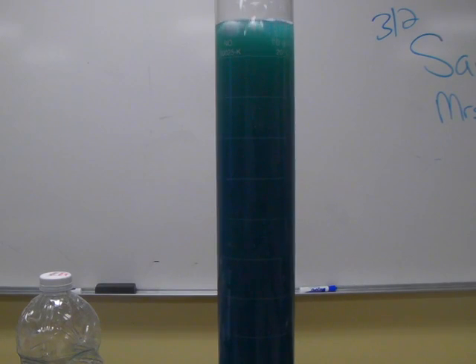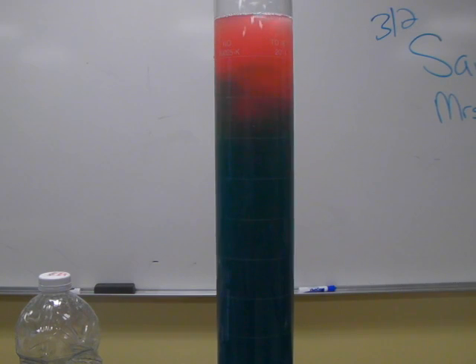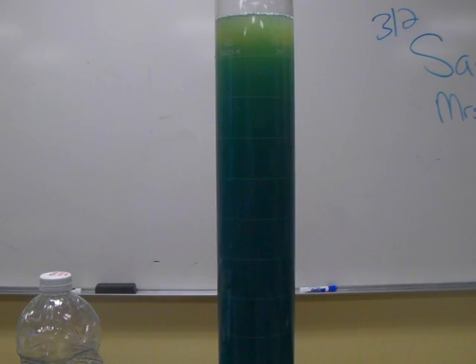We'll add some more. Again, when this is added, the free hydrogen ions cause the pH to drop. We see a color change that indicates a pH drop all the way down to 4. And then we see as those hydrogen ions are bonded to the hydroxide ions in the solution that they no longer can affect the pH, and the pH rebounds until it returns to the original. As long as there's excess hydroxide ions, it will continue to buffer against changes in pH.